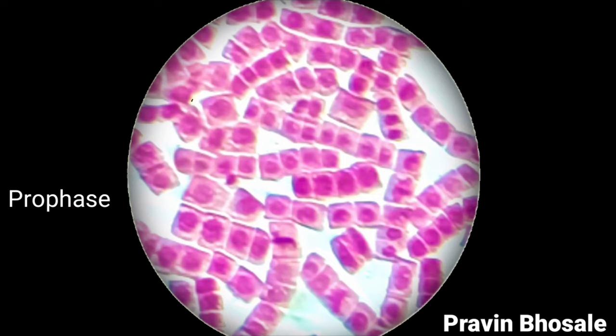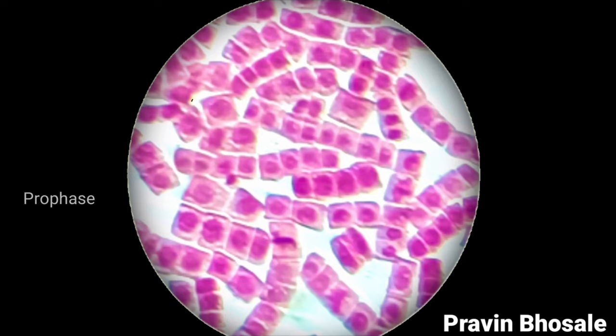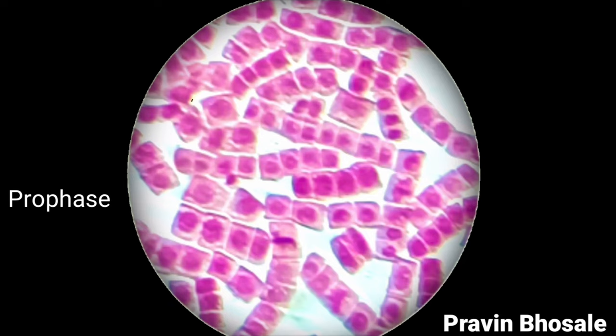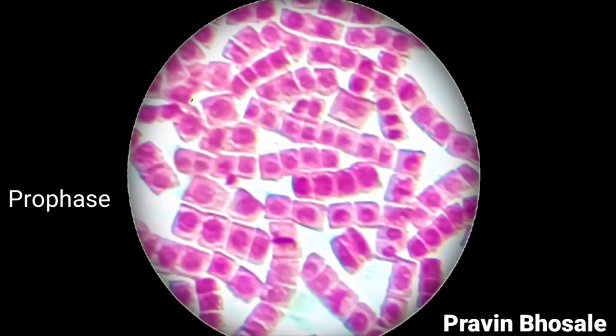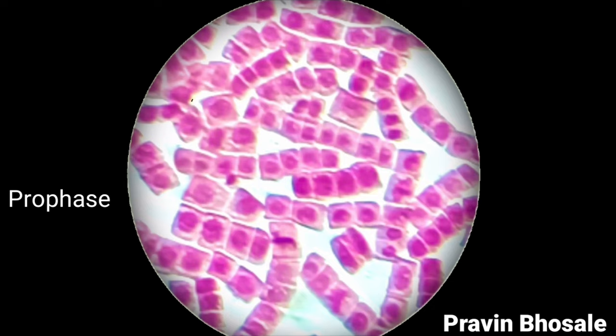When you make a slide of mitosis, maximum cells will be showing prophase stage. So if you're not able to identify metaphase, anaphase, or telophase, tell the examiner this cell is showing prophase. So this was all about the stages of mitosis.